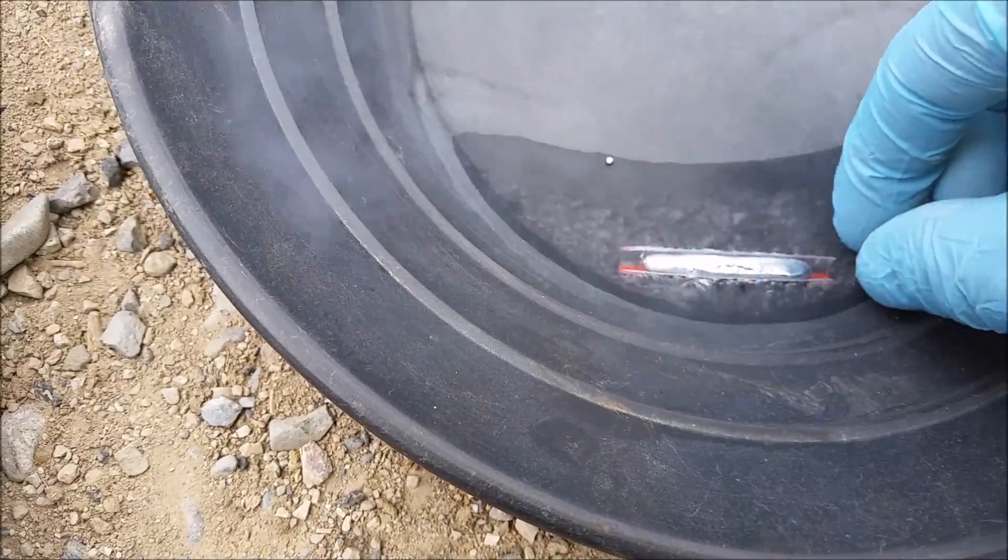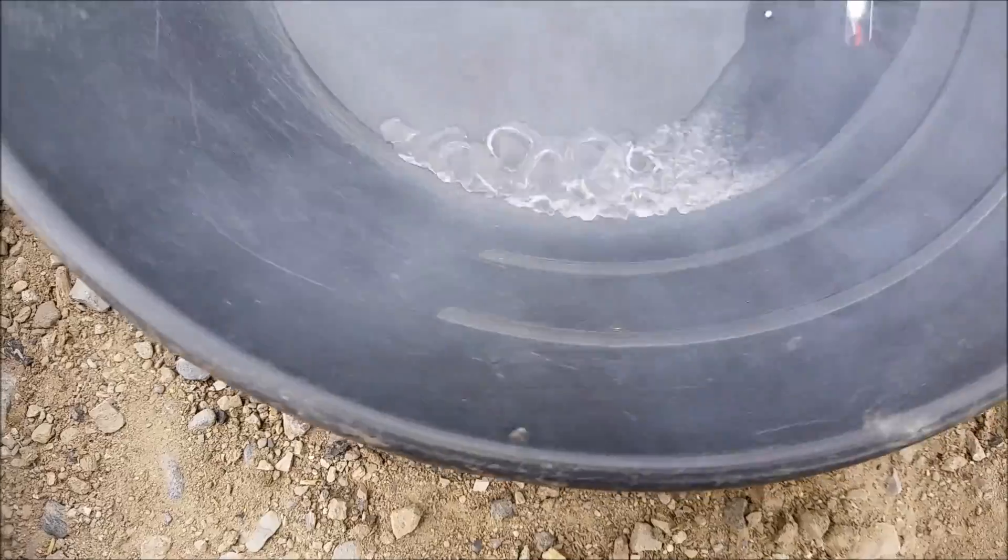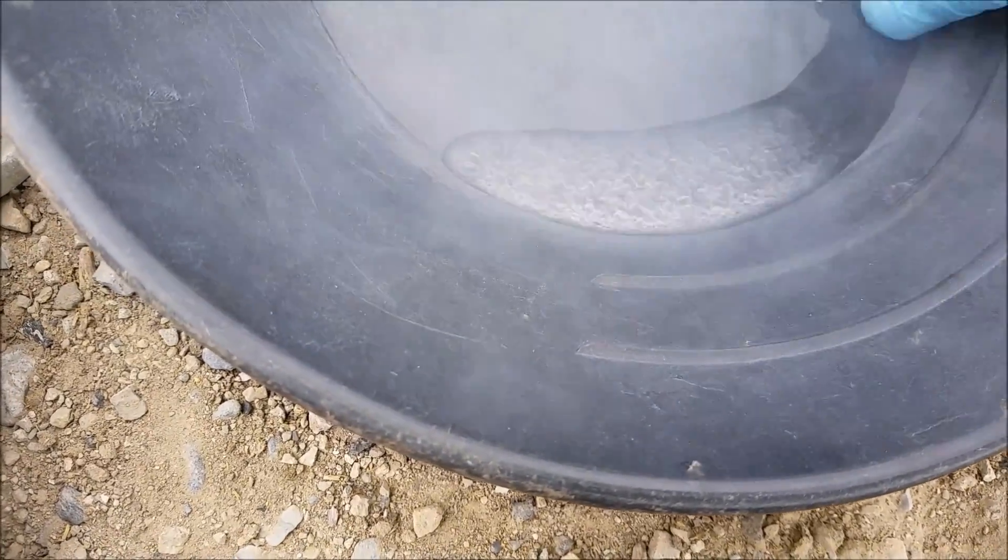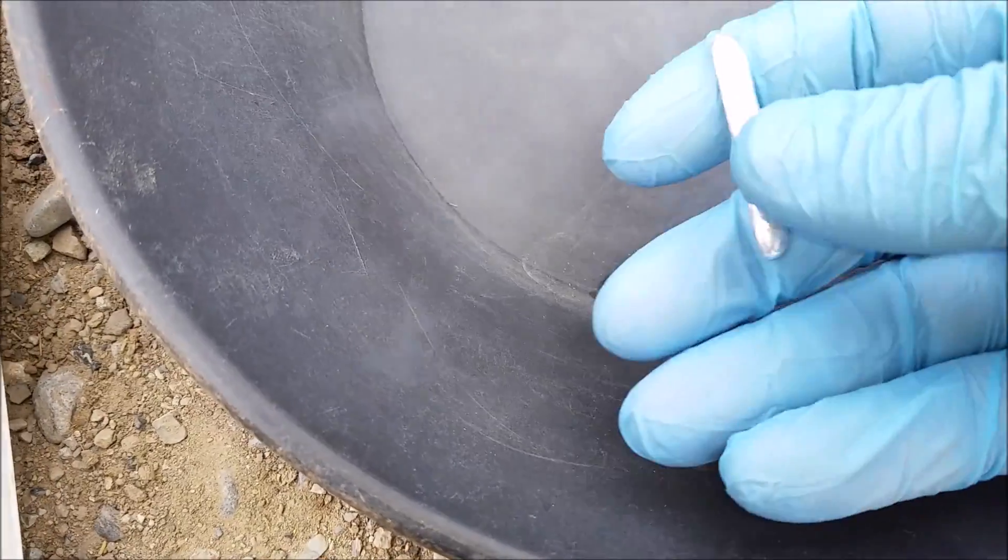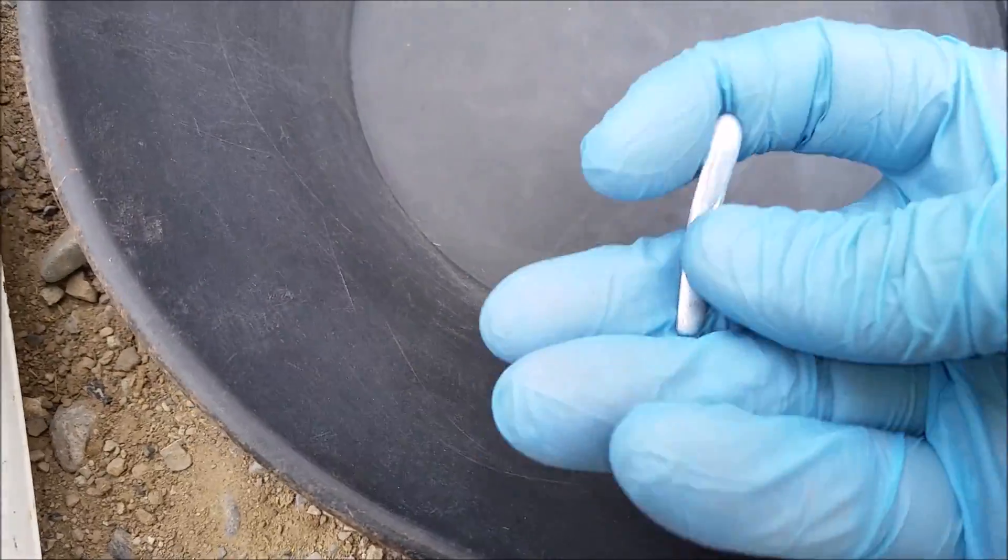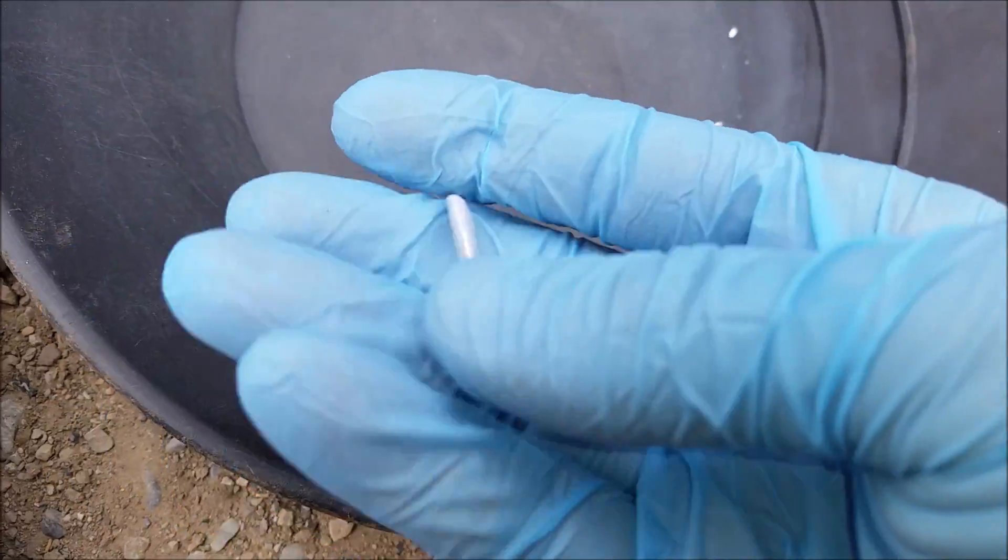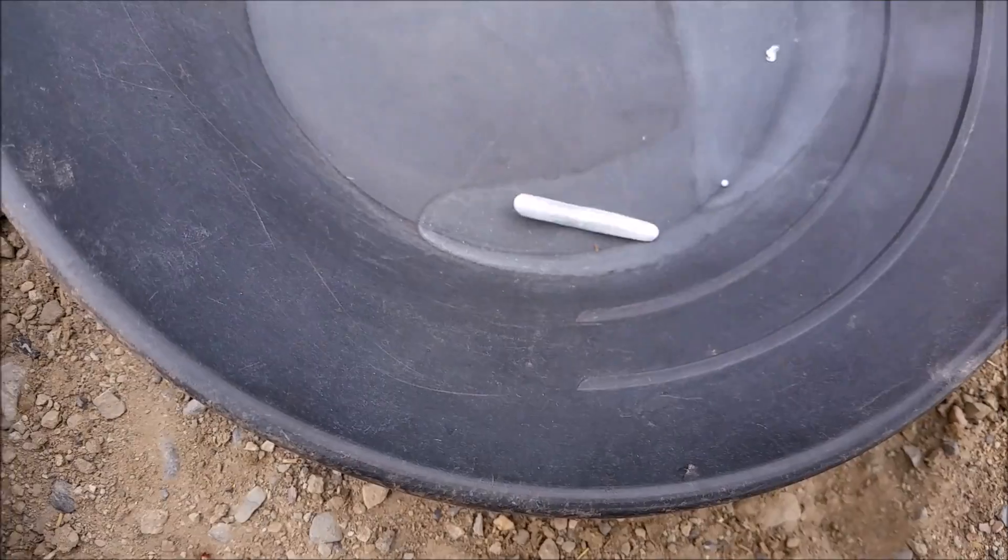Alright, it's now about negative 200 C. Let's go ahead and dump off the nitrogen, get this mercury out of the straw. Here we go. Hear that crunchy noise? It's like tin. Makes a tin cry almost.